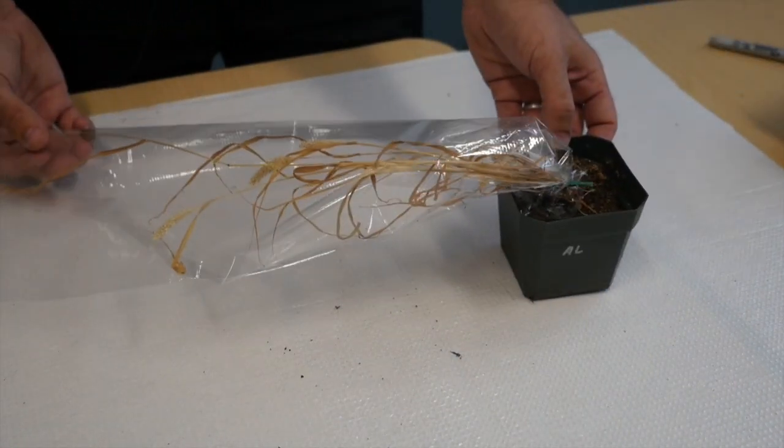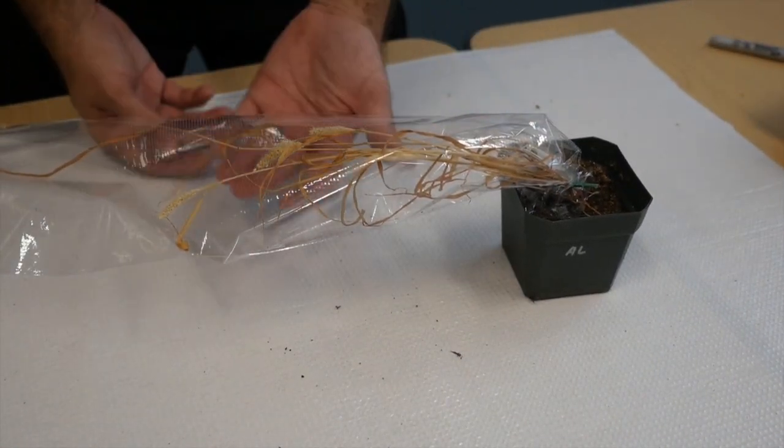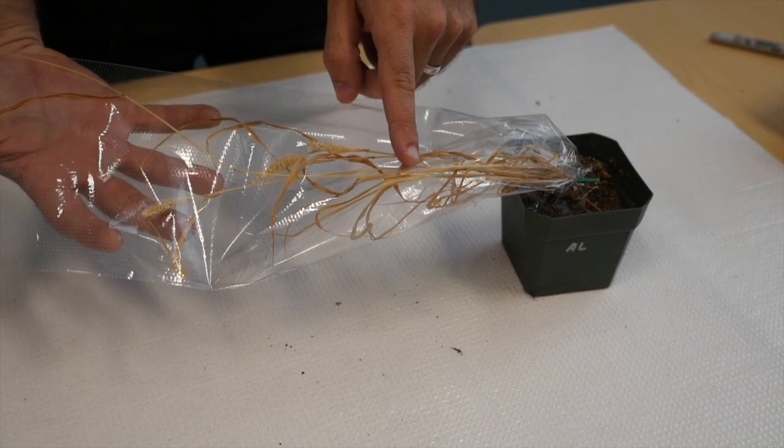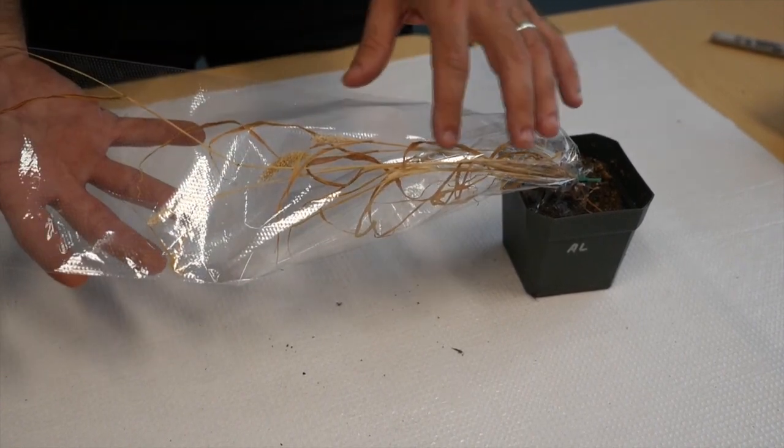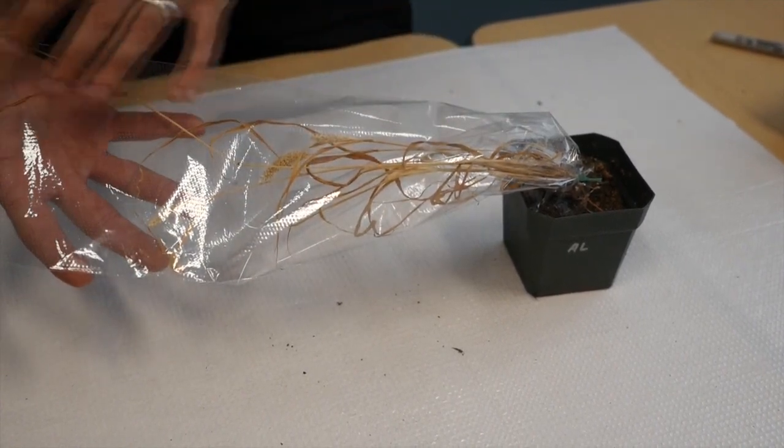So you should have your plant bagged up and you stopped watering a couple of weeks ago. It should be dried out like you can see it here.